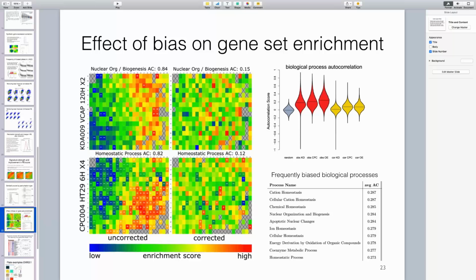In the other case, on the top, we actually don't have any enriched signatures after correction. And as we've seen, we can also apply the autocorrelation on the enriched terms. If we calculate the enrichment score for every sample on the plate, we can just calculate the autocorrelation. And so that's the plot on the top right.